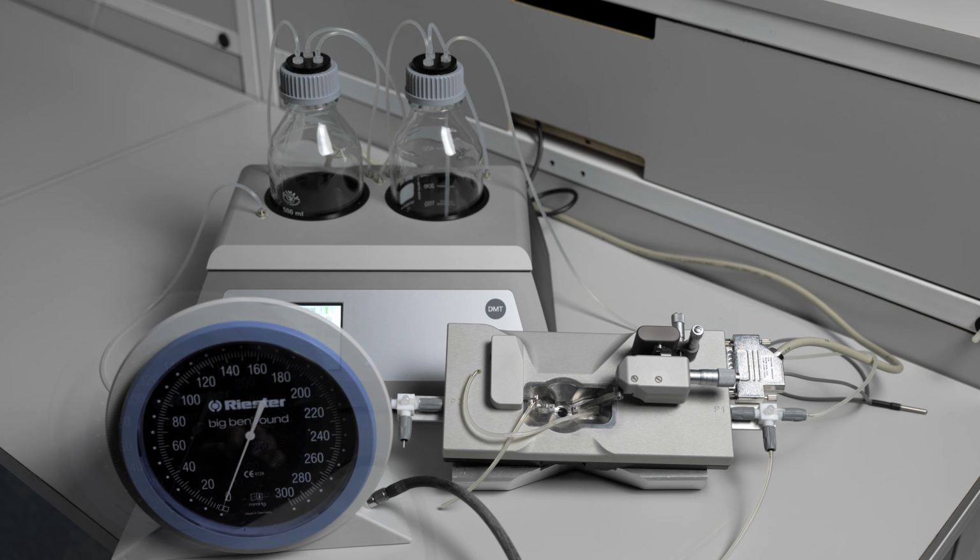you should contact your DMT representative to let them know that you have a pressure leak near the P1 pressure transducer. The three-way valves on the pressure chamber can be broken if the chamber is accidentally bumped into the bench or the microscope or anything else.